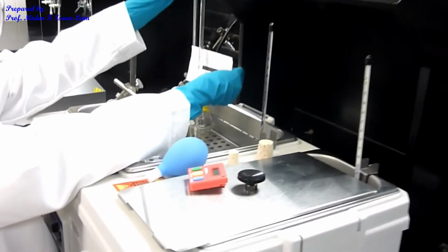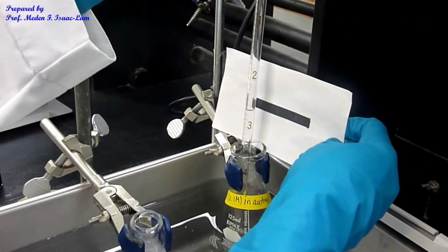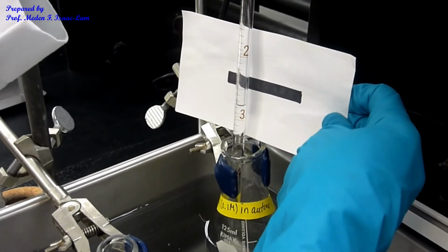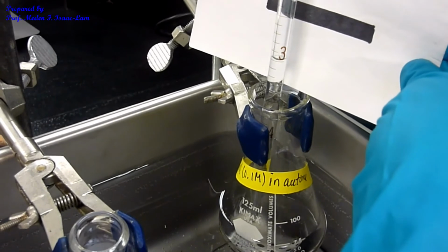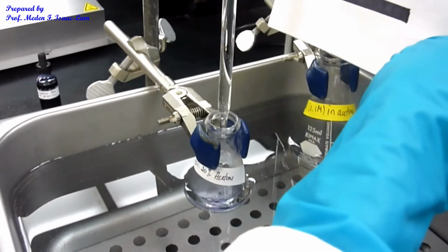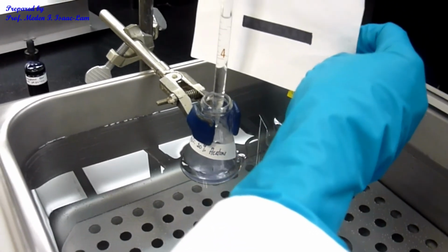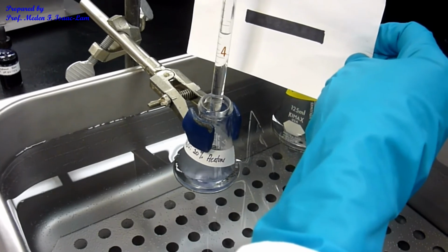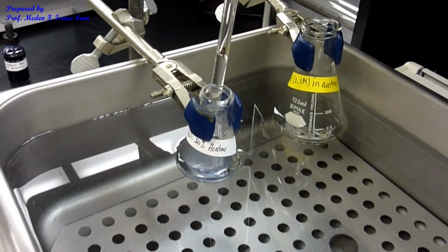Okay, so I have 3, and then I'm going to deliver about 1 mL to 4, and I'm gonna start the time.